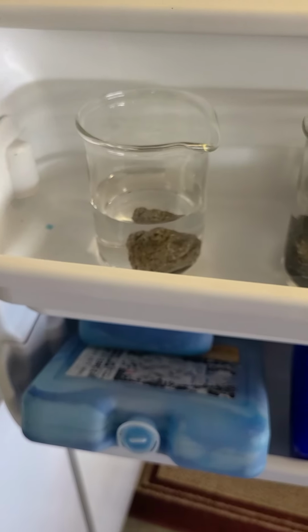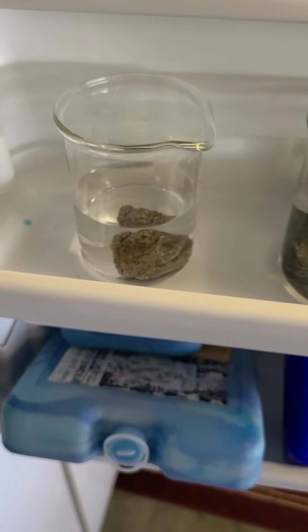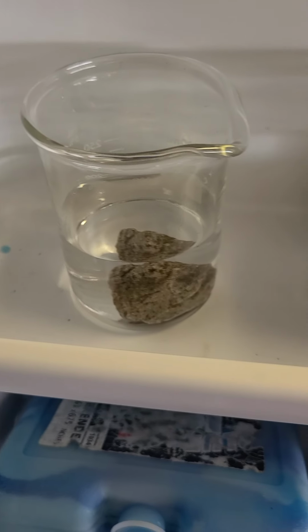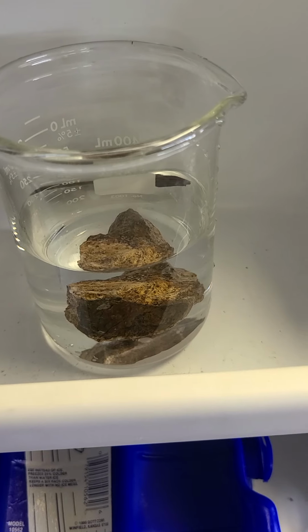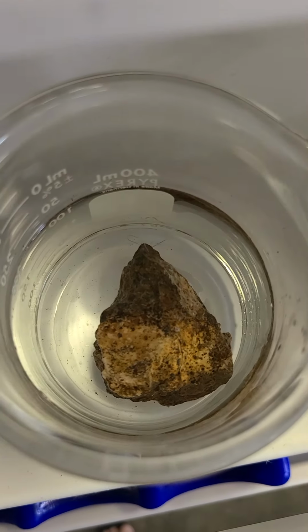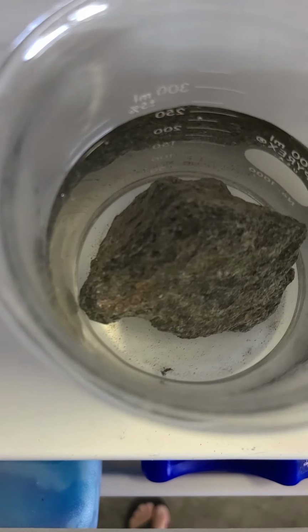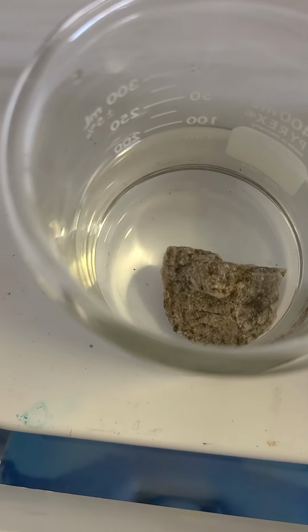Okay, here I go. I've got all filled up with water, the samples that are going to go into the freeze-thaw. There's sample A in the freezer. There's sample B. And there is sample C. It looks like 2 of them, but it's not. That looks a little bit better. Do that like that as well. Everybody can kind of see it. And there we go.